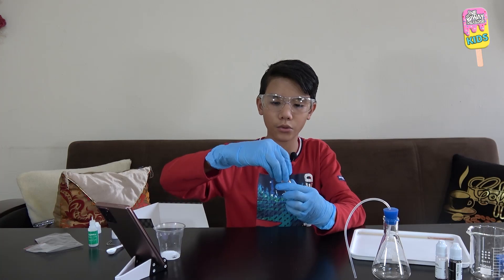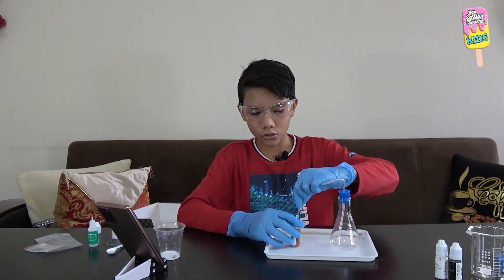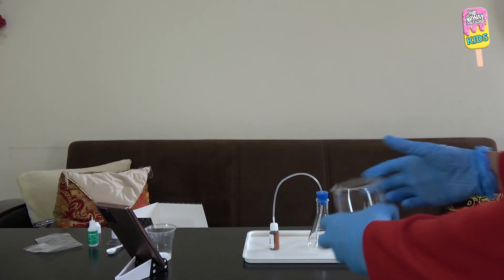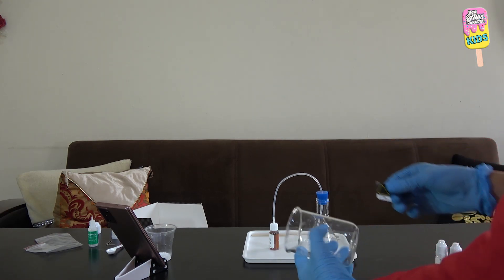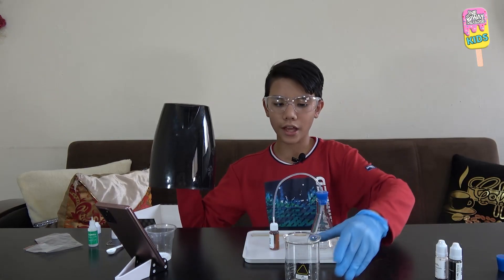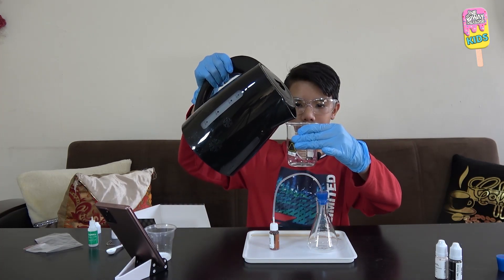Now I will secure the copper with the nozzle and insert the nozzle into the tubing, just like this. For the next step, we'll need to add some hot water. While my hot water is boiling, I will apply the thermal sticker onto this beaker, just like that. Now that my hot water is done boiling, I'll fill it to the 100 milliliter mark.